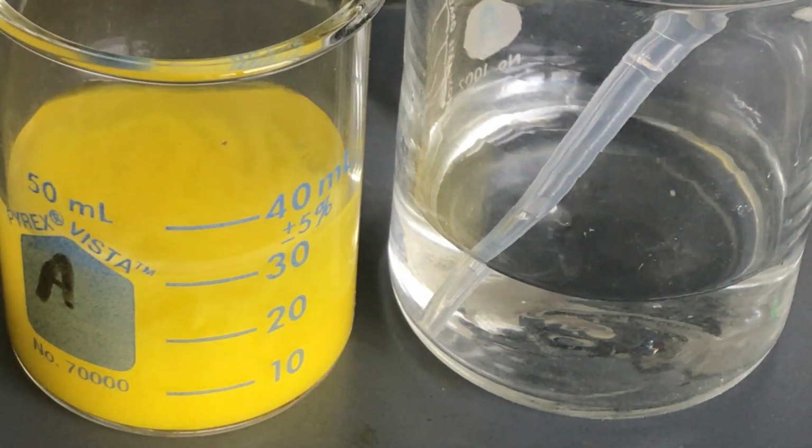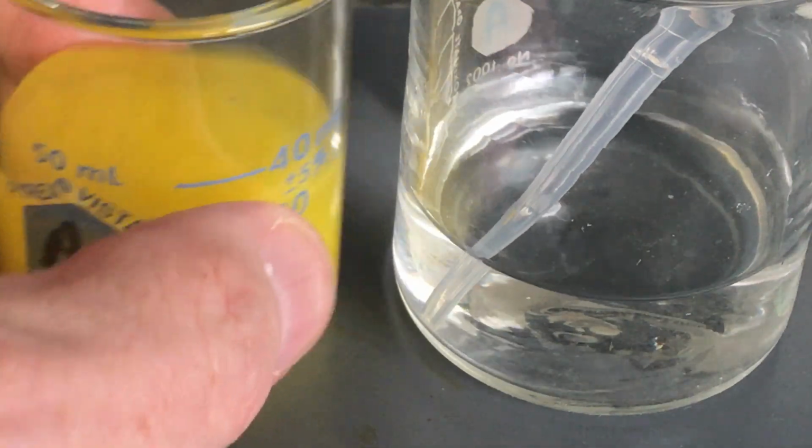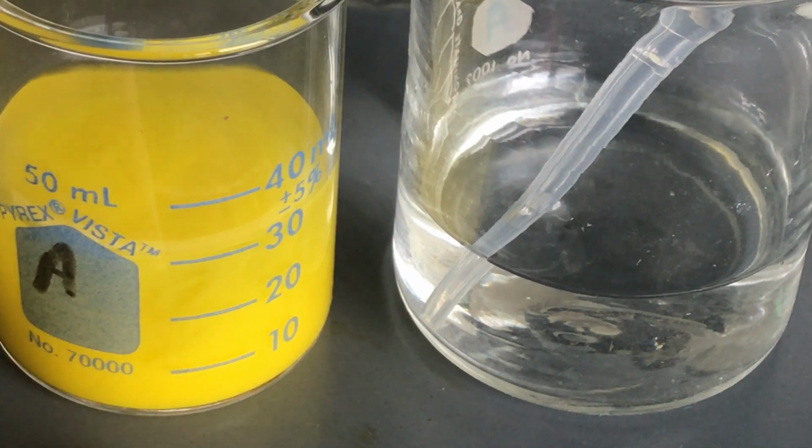Now, you would never want to really throw lead components down your sink, because eventually they're going to get into the water supply. Maybe they're going into a lake. The fish is going to eat it and breathe it in, and then it gets in the fish, and then you eat the fish, and so you end up with lead poisoning. So you have to be very careful. I'm going to let this stuff settle out overnight, and I will basically go through the process of filtration. So check the video out for the next one for filtration, and we will dispose of this properly.